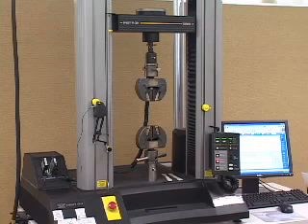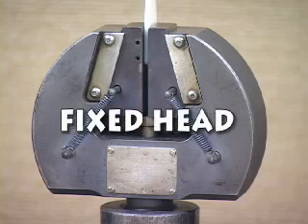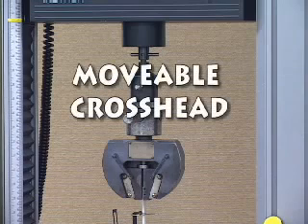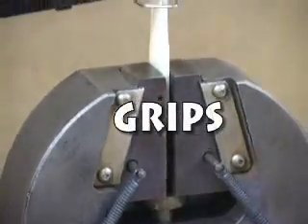The apparatus used to perform tensile testing is comprised of the following major components: a fixed head or stationary member carrying the grip, a movable crosshead or member carrying a second grip, and grips for holding the specimen between the fixed member and movable member.